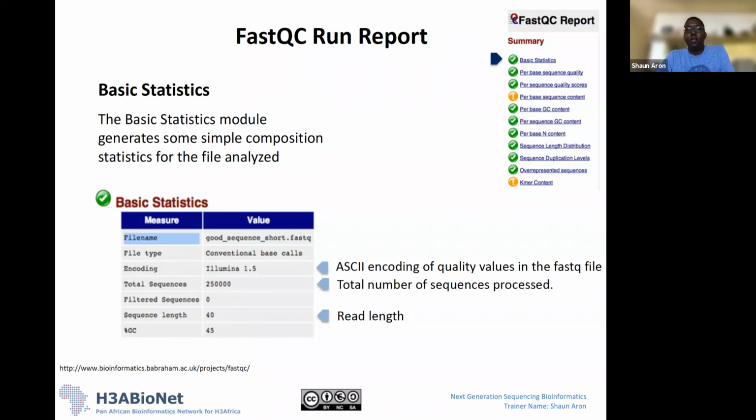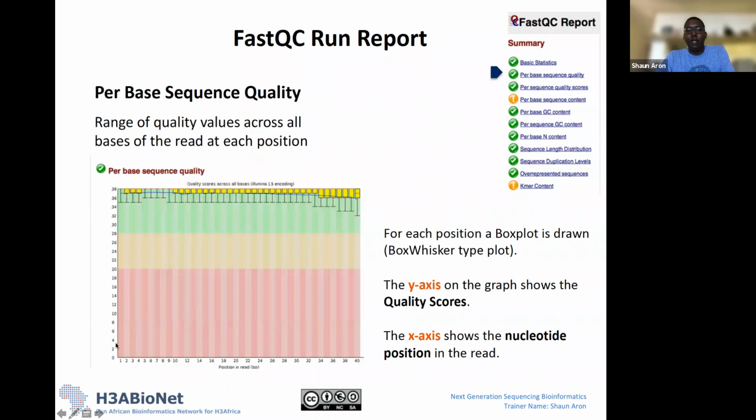Essentially, on the y-axis you have values from 0 to 38. This is our quality score. On the x-axis, we have positions in the read, from 1 to 40. What it's done is look over all 250,000 reads, and at each position, it's plotted the quality score distribution of that position.